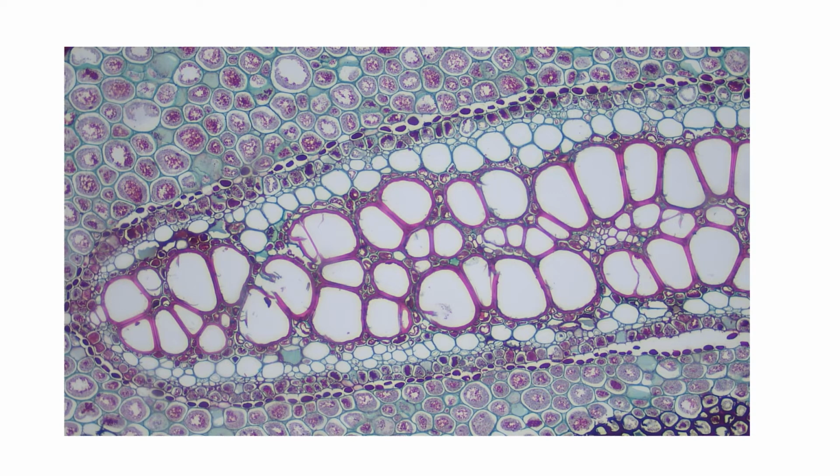Looking closer at our fern, you can see the very clear large cells and small cells around there. And so this is our phloem on the outside, those little cells. They look green here, but that is them. And then the xylem along the inside. So the xylem is the tissue that conducts water. The phloem is a tissue that conducts the food and other things that the plant will use. And so both are considered part of vascular tissues.